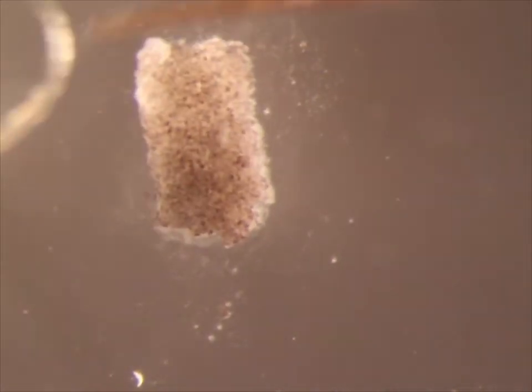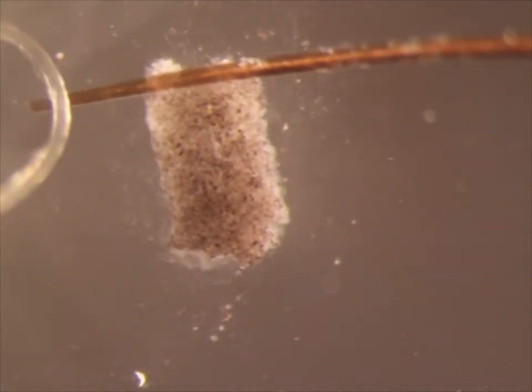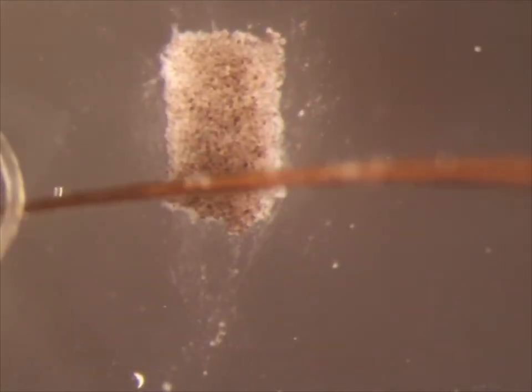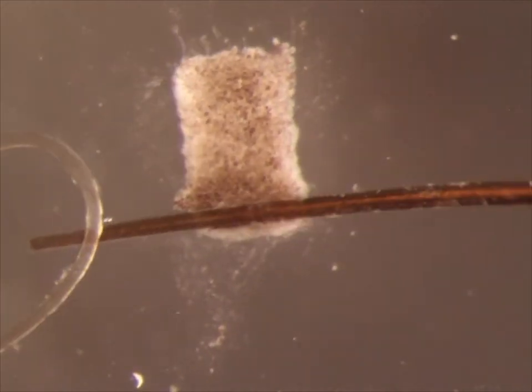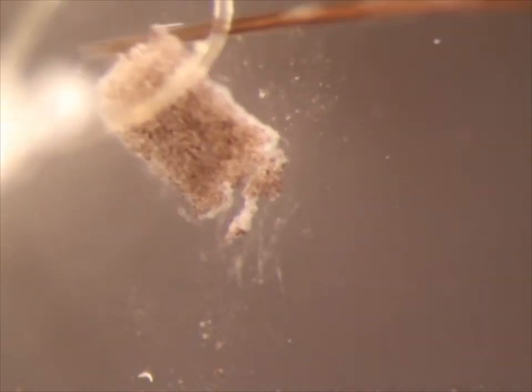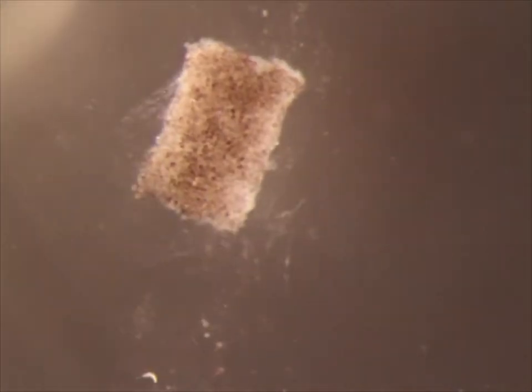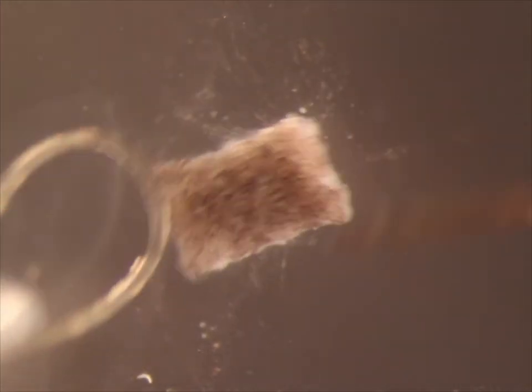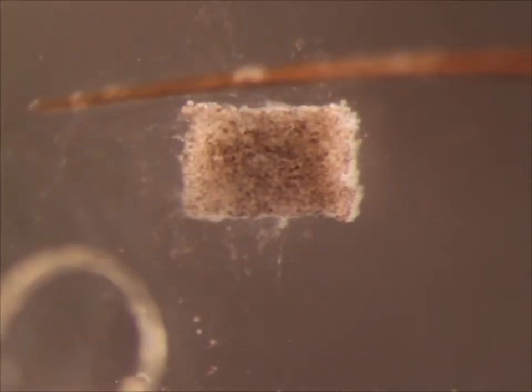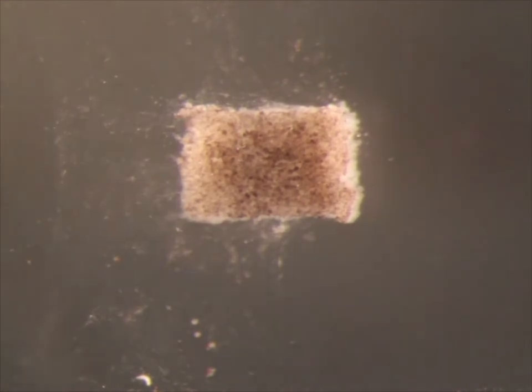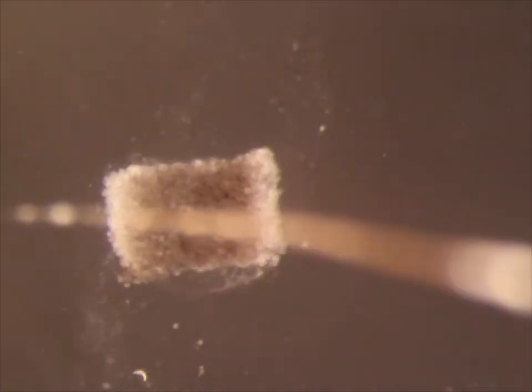Note how much more challenging it is to get a clean cut when the pigmented side is up. In this lab, this is the desired shape for our explants, but in this video they were interested in cutting strips.